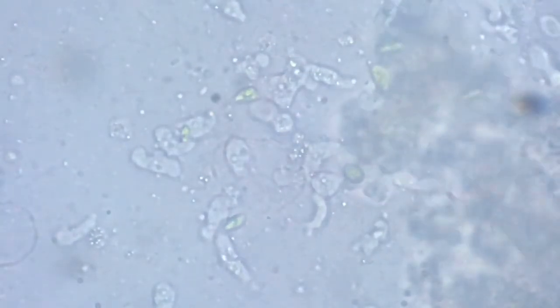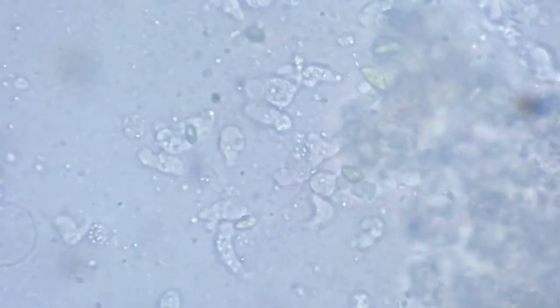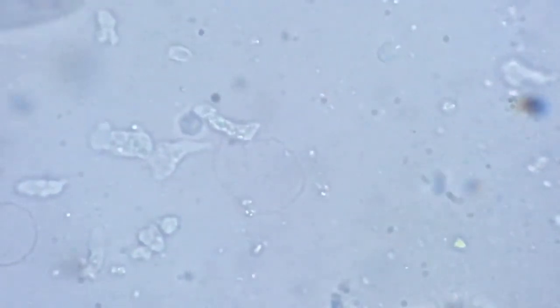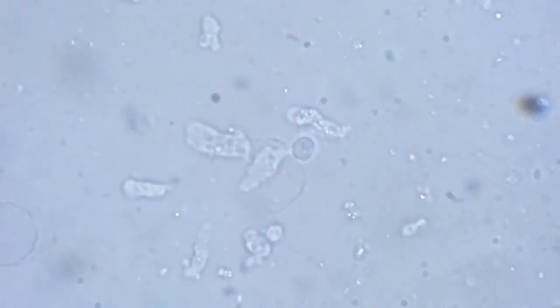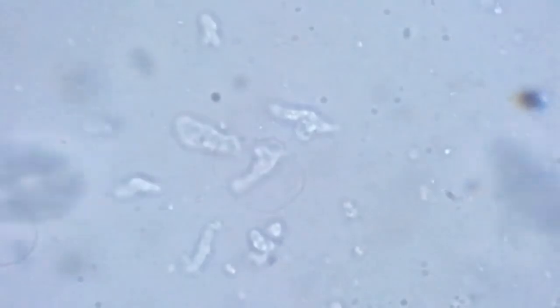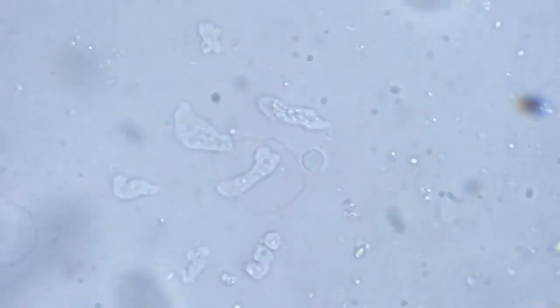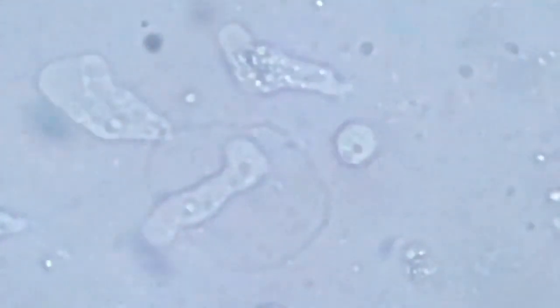We've spent around 15 minutes with these amoebae, and we can hardly get enough. Oh, look at this. What a gathering. Beautiful, beautiful creatures. Let's watch them walk.